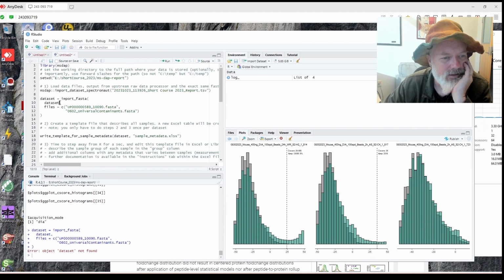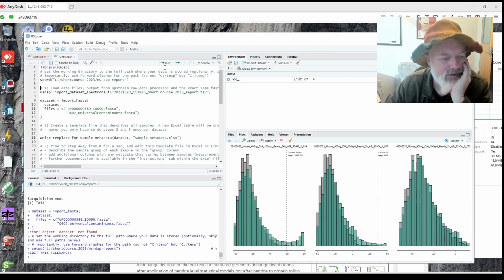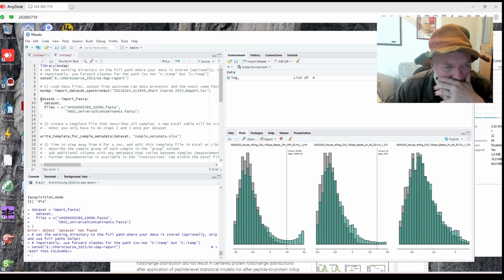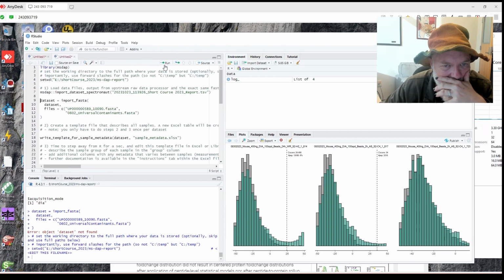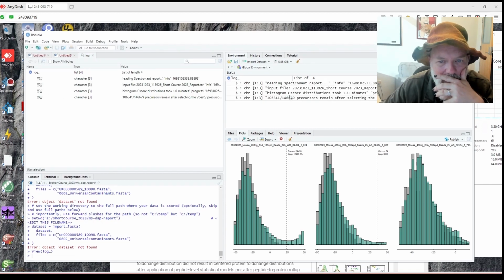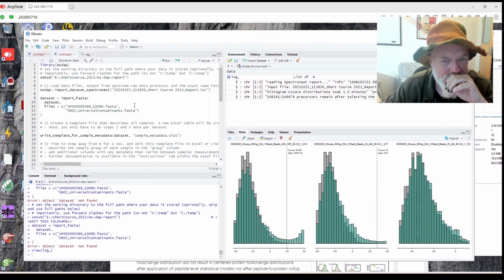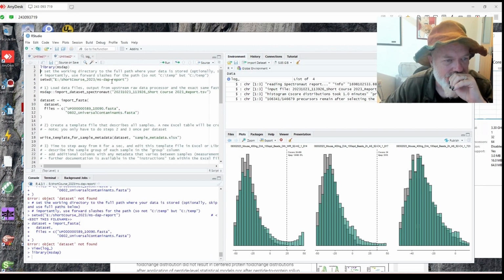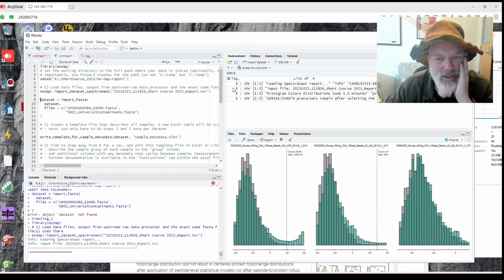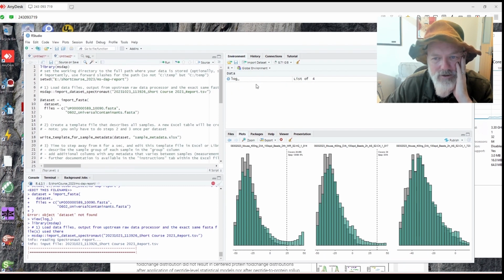What? Dataset equals import FASTA. What do you mean dataset not found? Doesn't it have a dataset? Okay, let's see. Run. Oh, why did I just do that again? Okay, so let's see. Dataset import FASTA. I thought I would do that correctly. Import dataset Spectronaut. Dataset not found. Oh, something happened. There usually is a dataset here. Why didn't that work? So let's see, MS DAP, import dataset Spectronaut. Something didn't work. Let's try that again. Oops, we're up here. Let's see. Okay. I don't think it actually worked. It just showed the log file. But for whatever reason, it didn't load the dataset.